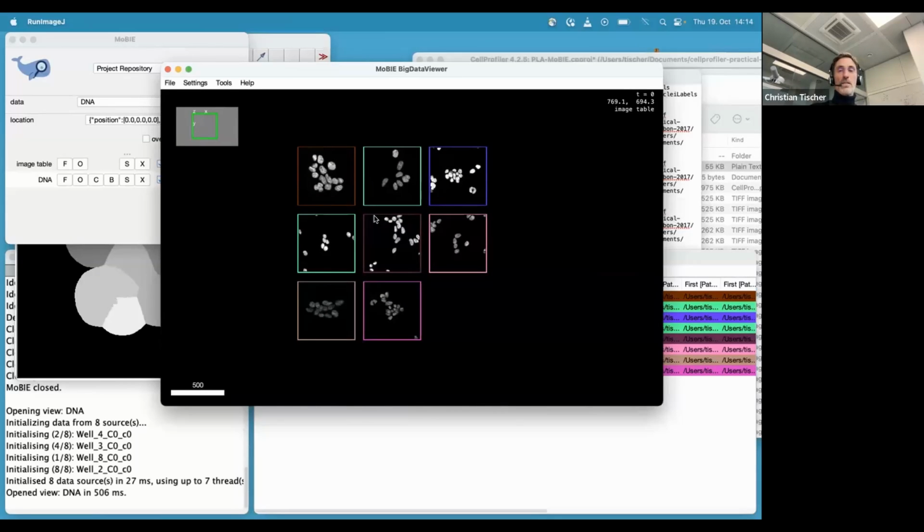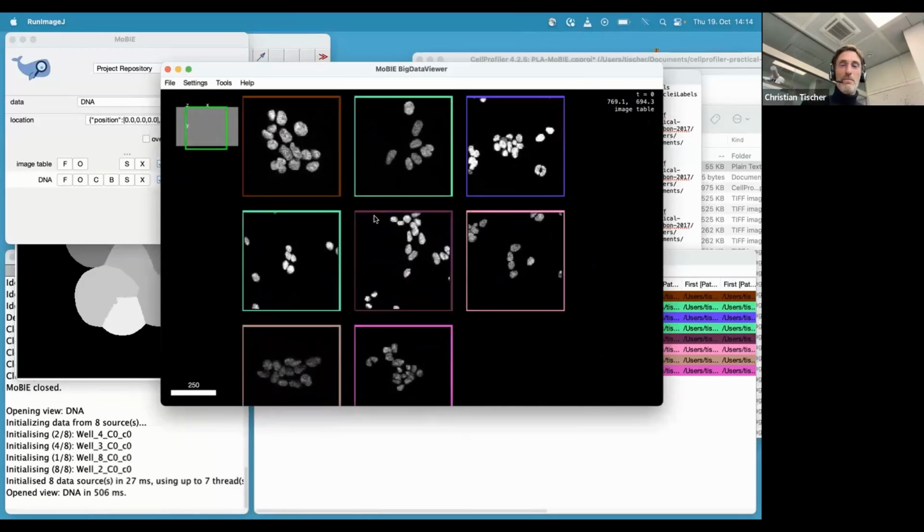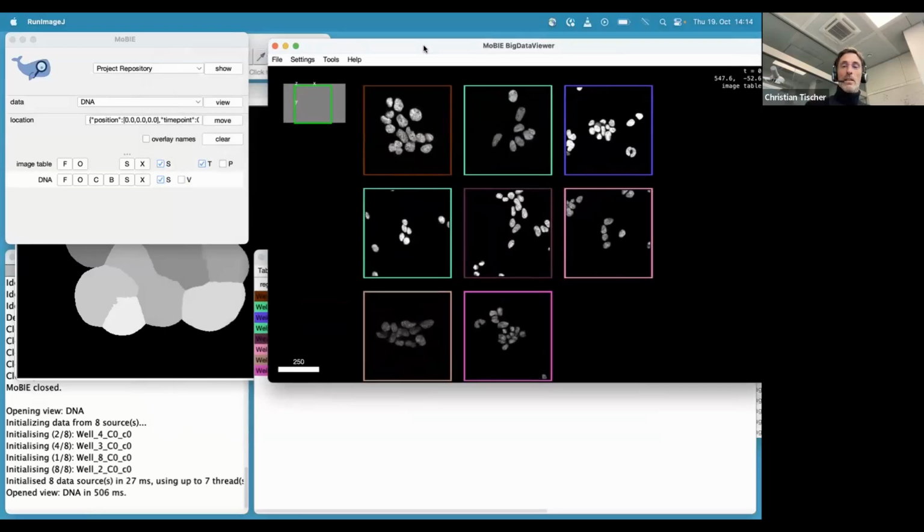I think if it's 1,000, it would still be pretty fluent. So, but I mean, let's see. One can always break stuff, but it's pretty good in terms of having a lot of data. So you can just look at them, right?